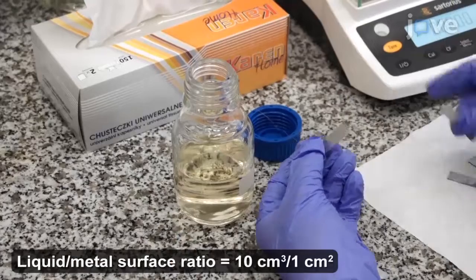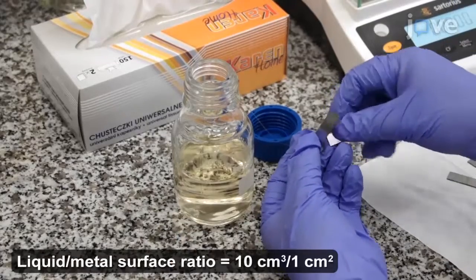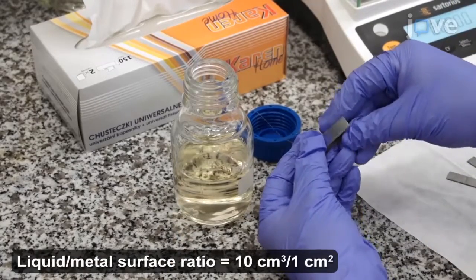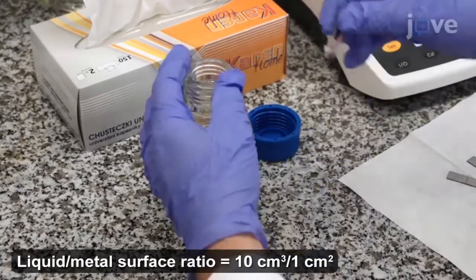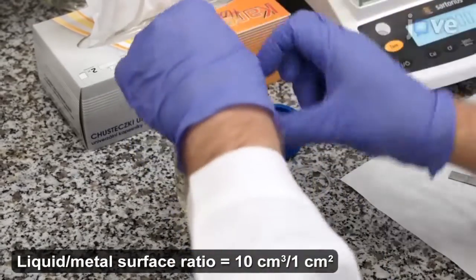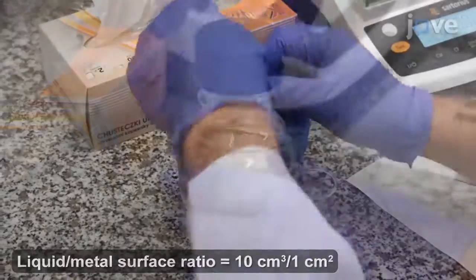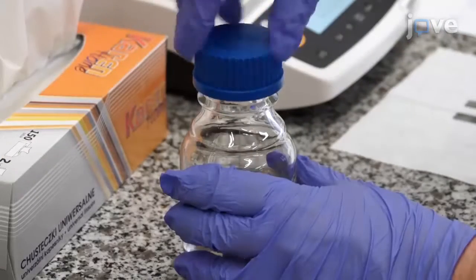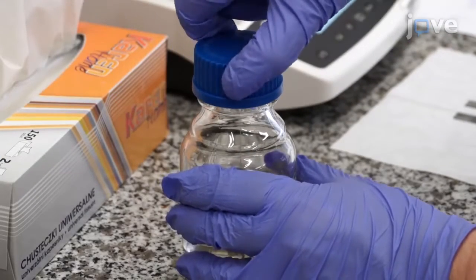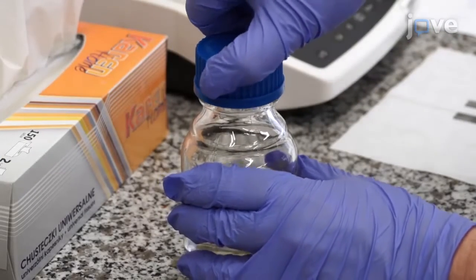Hang the metallic sample within the bottle so that the sample is submerged within the liquid but does not lie on the bottom of the bottle. Then close the bottle tightly enough to prevent liquid evaporation and air entry.